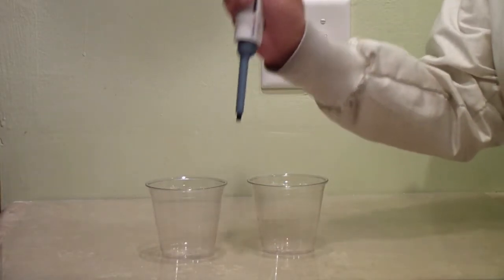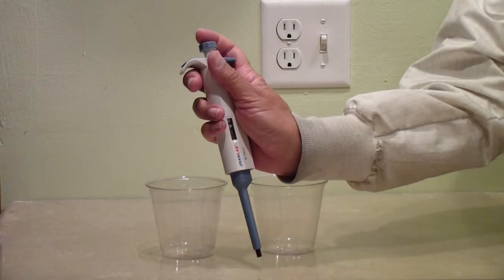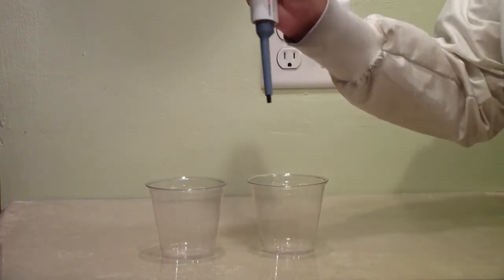Let's go over this again and explain why we use the pipette this way. You hold up the pipette in the air and press down on the plunger before you put the tip in the liquid.